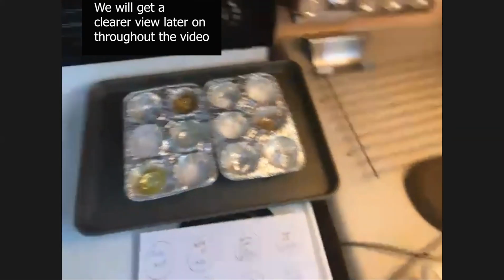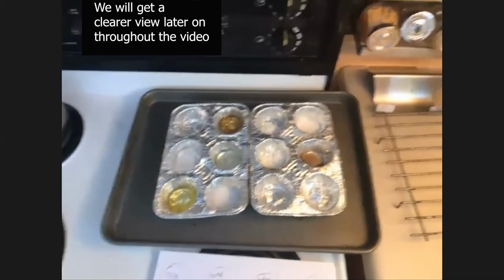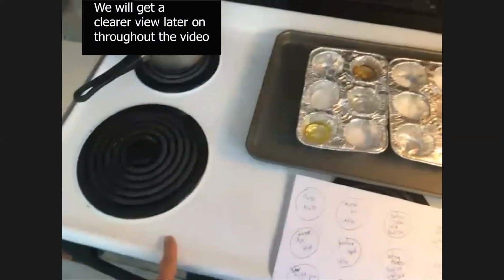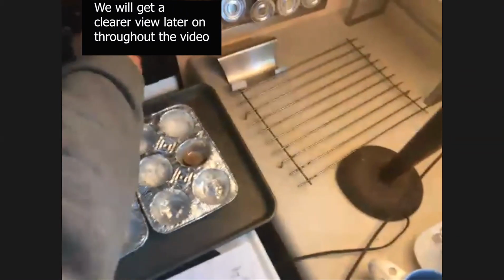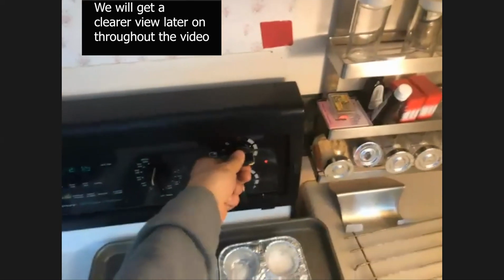So what we're going to do here is look at these substances that we have in these muffin containers, and start to pay attention to what happens when I supply energy to them. Crank it up. So I turned it up to about 3/4 of the height.